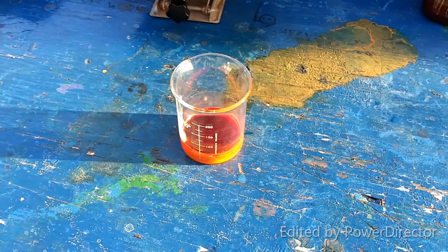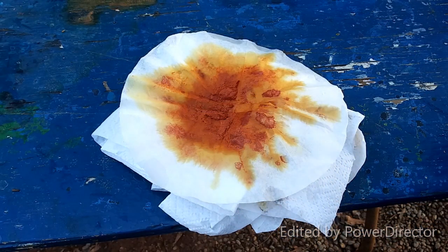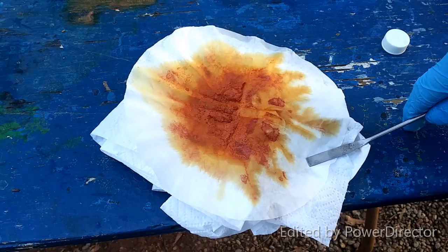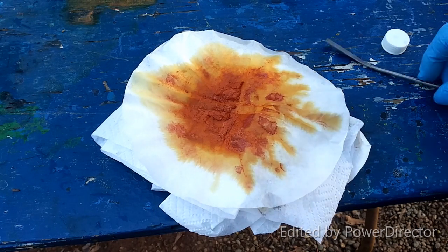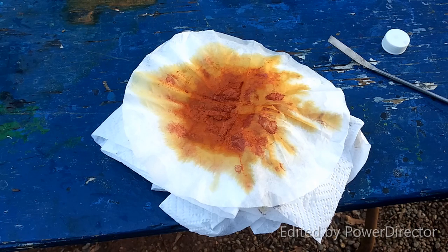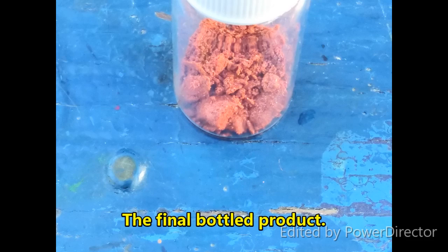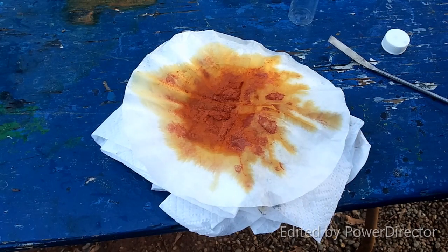What I'm going to do now is cover this up and let it continue to crystallize. After the solution cooled down, I filtered off all of the arsenic triiodide and pressed it dry. I was going to try drying it like I did the antimony triiodide, but on further thought I decided to pass on that. Arsenic triiodide is pretty volatile, and I couldn't get a clear reading on just how volatile it is. Standing over this stuff while it's hot — probably not. So it's been pressed dry a few times, and we're just going to go with this.